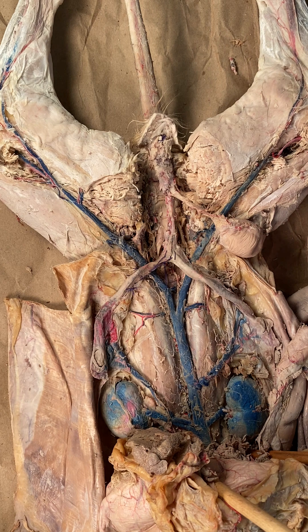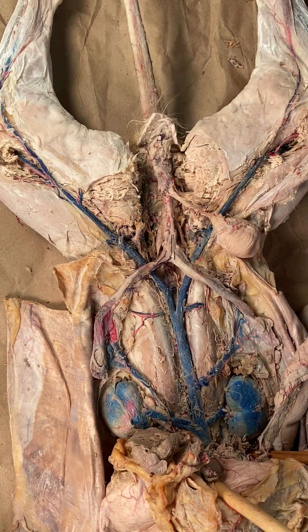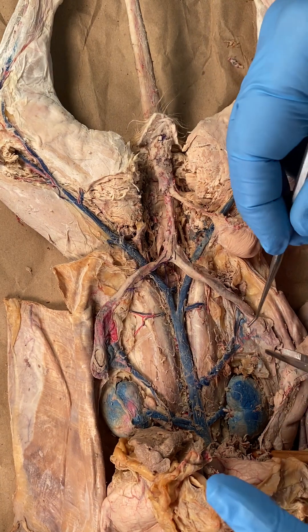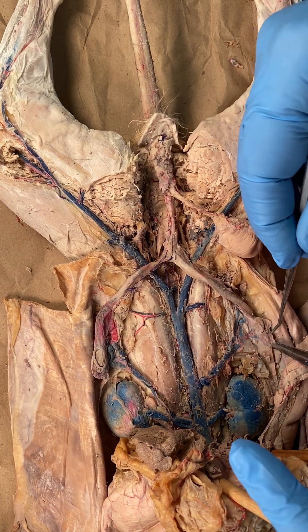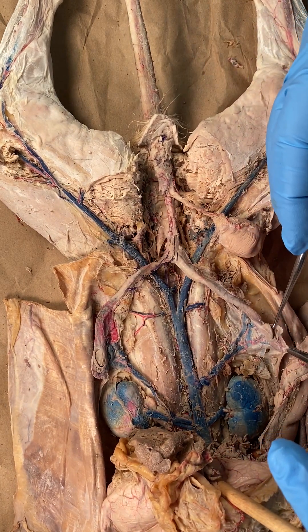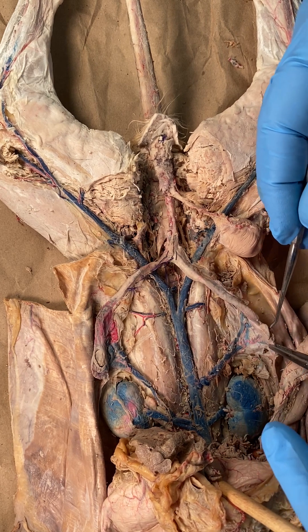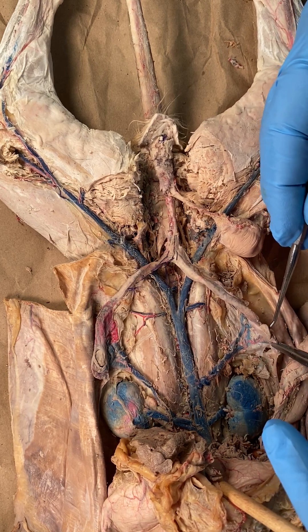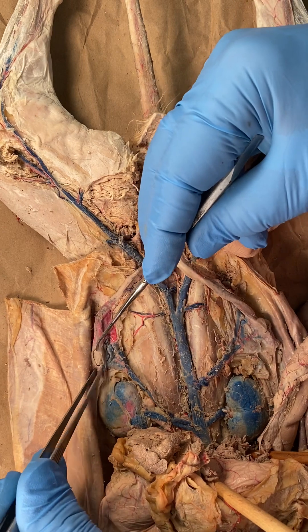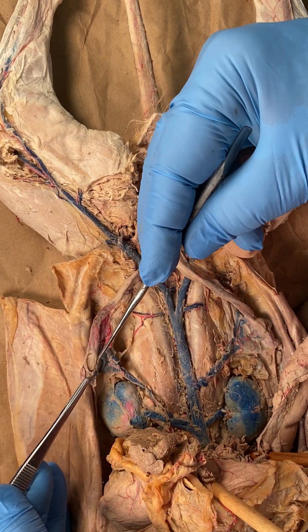What we'd observe first, we're going to start all the way up by the ovaries. We're going to cover the main structures first, but that little sesame seed-like organ way up here, that's the right ovary. All the way on the other side, that's the left ovary.